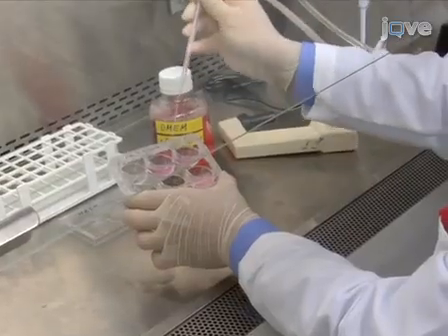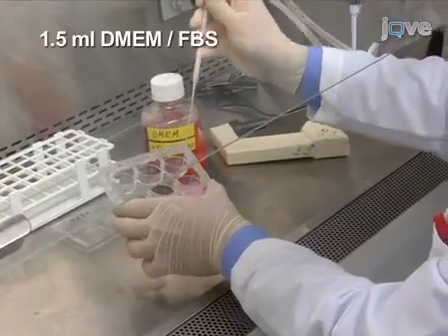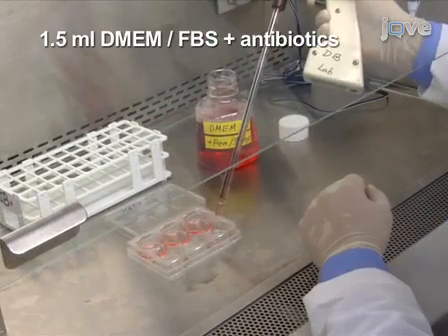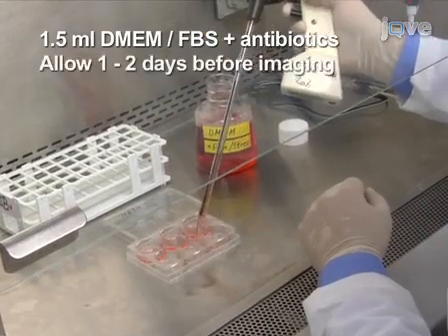Following the incubation, replace the media with DMEM FBS containing antibiotics. Allow the cells to express ratiometric pericam for 1 to 2 days before imaging.